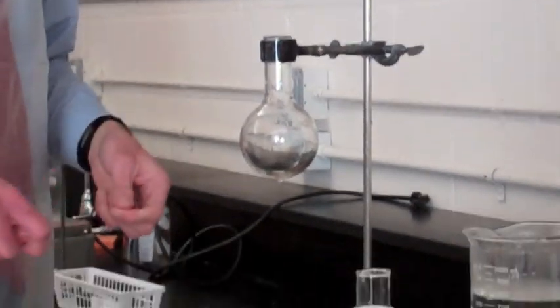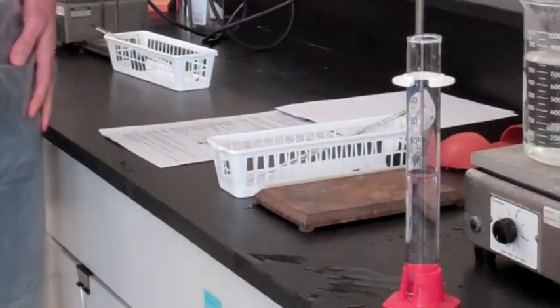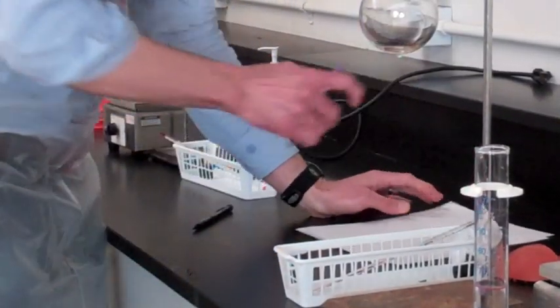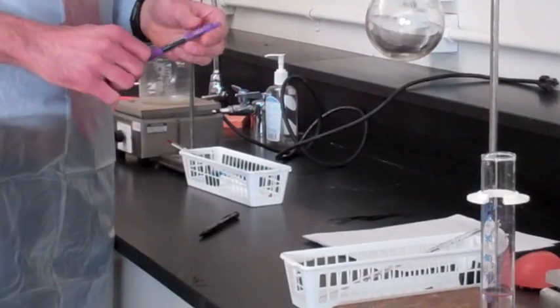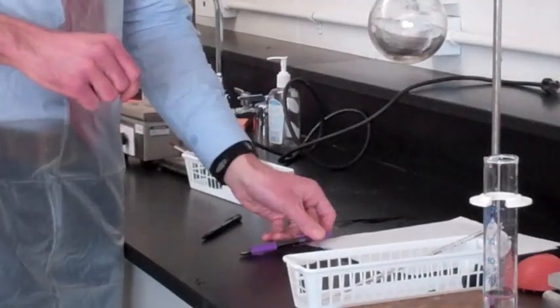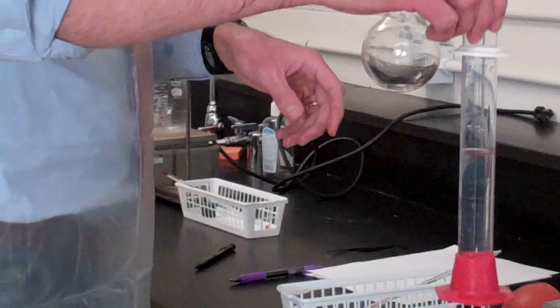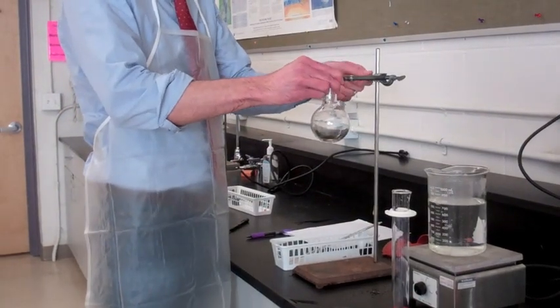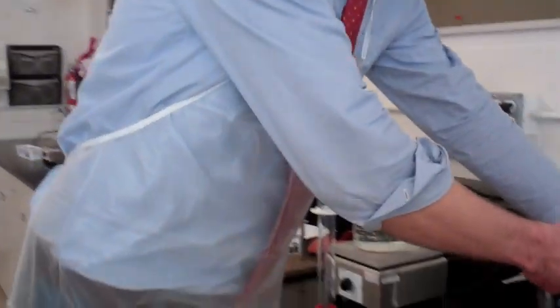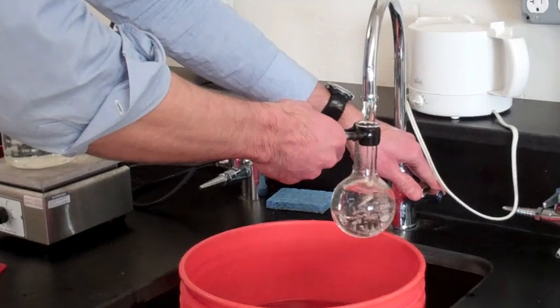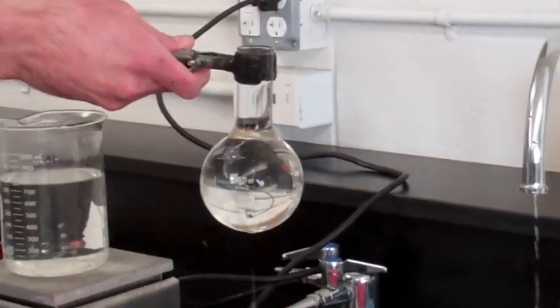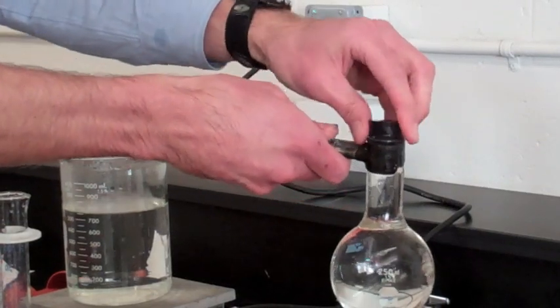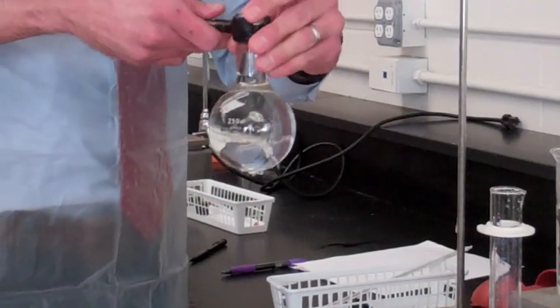Now, let's be sure we write that down before we pour it out in case we forget. We're going to get out our data table, and we're going to write down 62.3 milliliters. What other two pieces of information did we gather that also need to be on the data table? Temperatures. Temperature before and temperature after, or hot temperature and cold temperature. Now that we've recorded that, we can pour this water out. And the other piece of information we need to know is what is the total volume of this flask. If we fill it up with water, we can measure that. Only, was all that volume filled with air? Nope. We had the stopper to displace some of it. So, we're going to squeeze that stopper right in there. Take that out, and let's measure this volume.